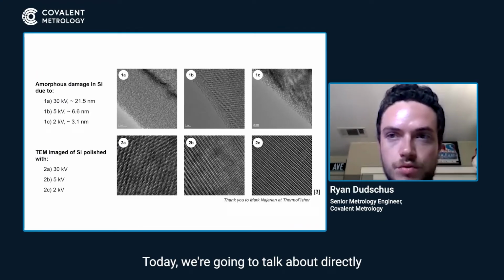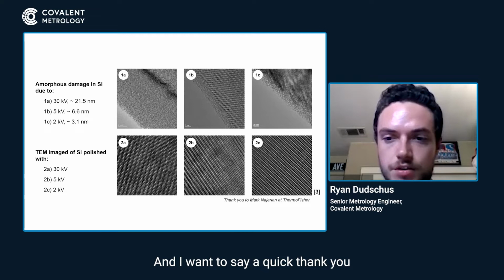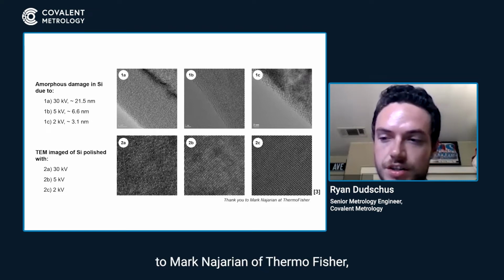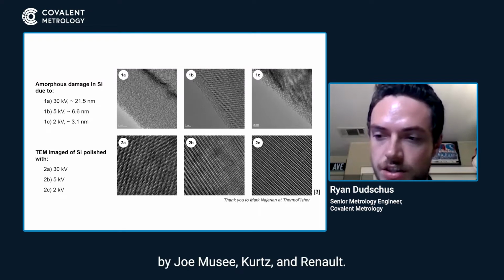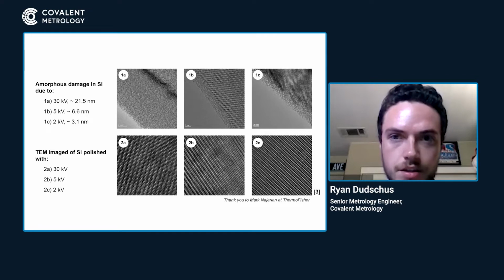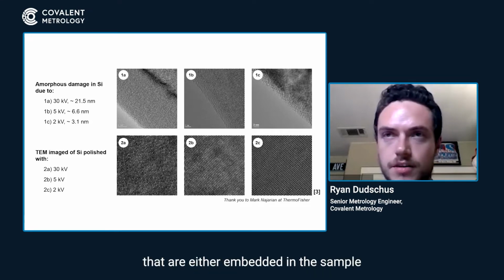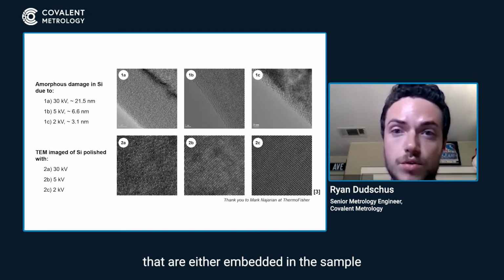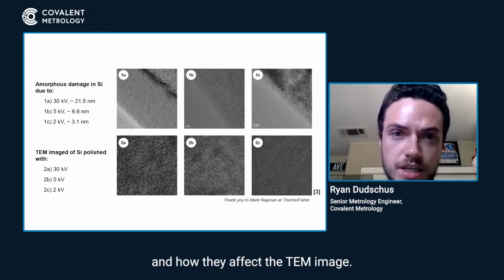Here we're going to talk about directly how the FIB damages the sample. And I want to say a quick thank you to Mark Najarian of Thermo Fisher, who gave us this wonderful paper by Giannuzzi, Gertz, and Ringnold. These show how the gallium ions that we talked about, either embedded in the sample or even the interstitial atoms, affect the TEM image.